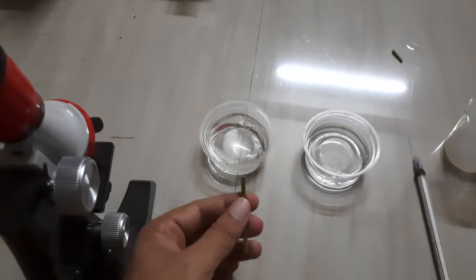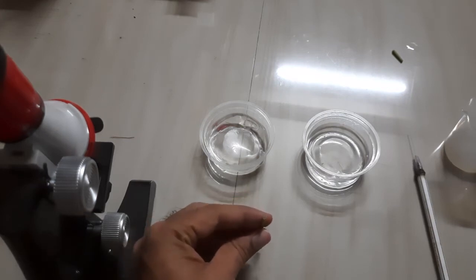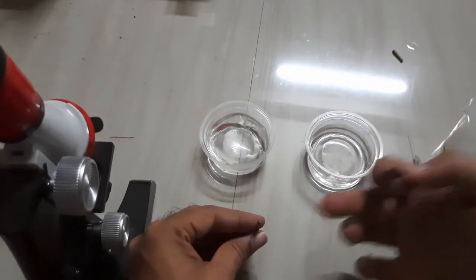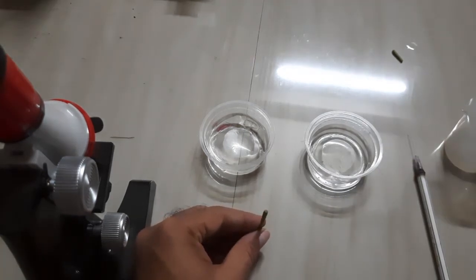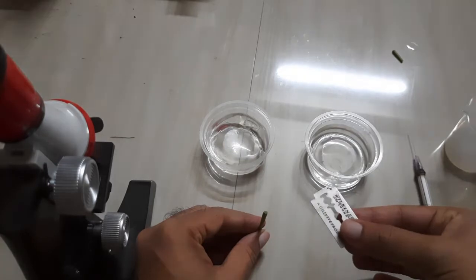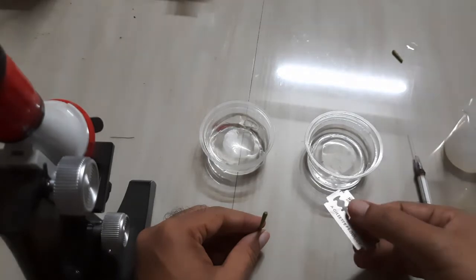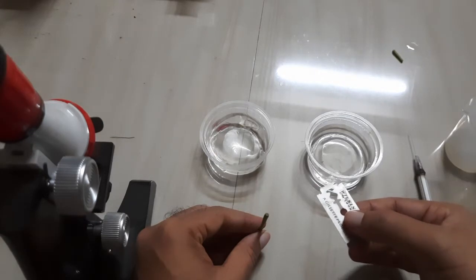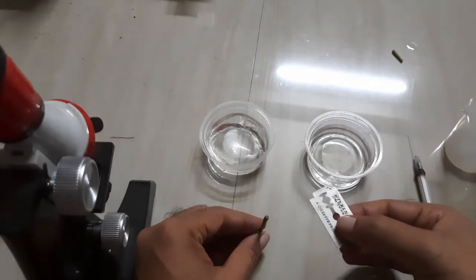First we have to take this specimen and hold it in this manner — meaning the specimen stays in a vertical form. At the same time we will take a blade, a sharp blade. Instead of a blade we can use a sharp knife, but in my personal experience a blade is more suitable for this purpose, and it should be a very sharp blade.